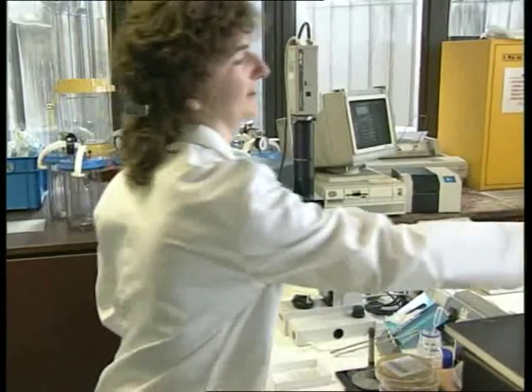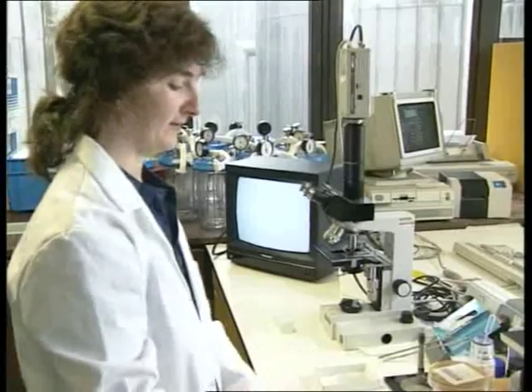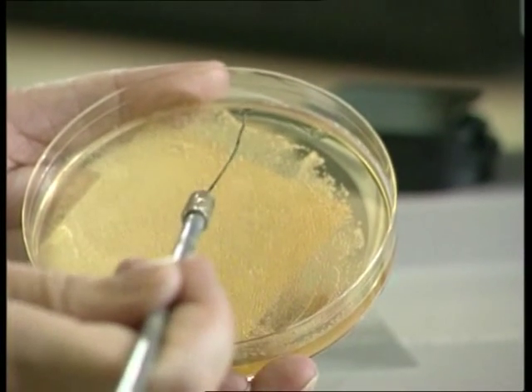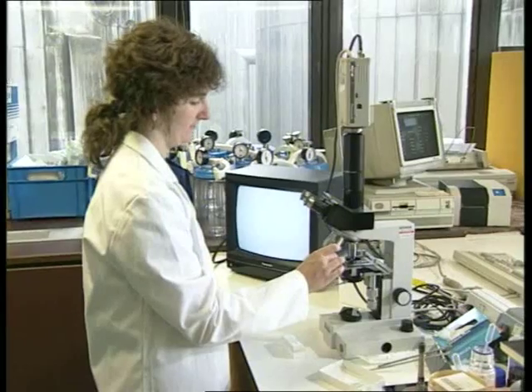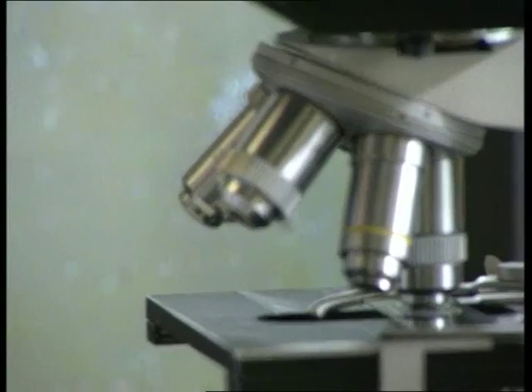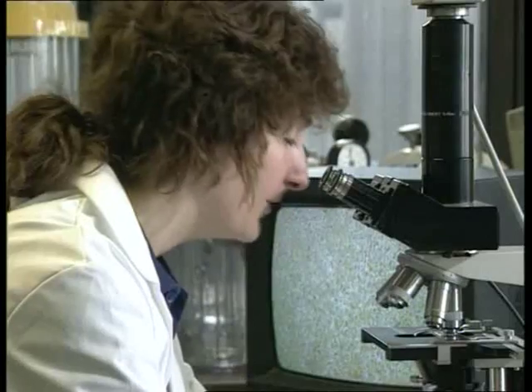I'm going to identify the organisms that have grown on the agar surface. We do that by looking at them under the microscope. Specifically on this agar, I'm looking for lactic acid bacteria, which are beer spoilage organisms. I've taken one colony off the agar surface and just made an emulsion. I'm looking at rod-shaped bacteria, which are lactic acid bacteria. We know that specifically because we grow them up on this specialised medium.